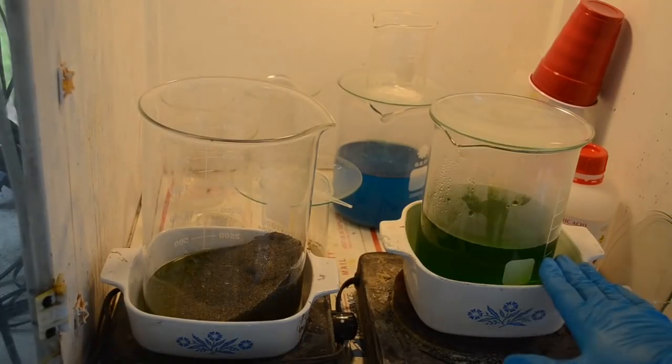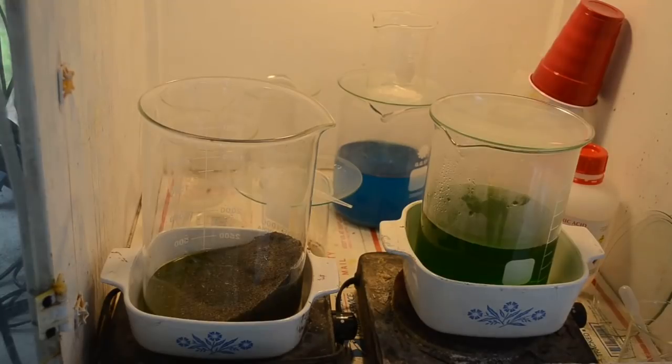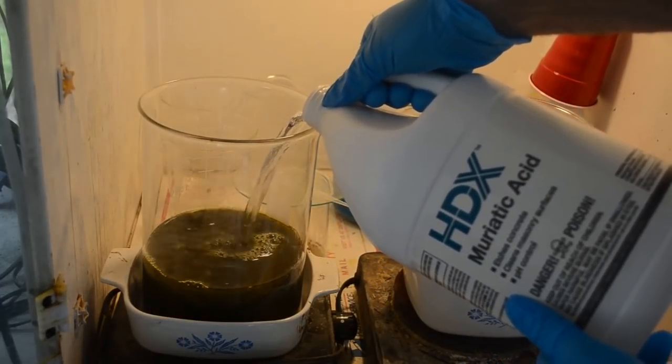Alrighty, so I got our liquid in here, but the first thing I'm going to do before I try to drop the gold out of this and fill the fume hood up with nasty sulfur dioxide gas is I'm going to get this second extraction started on this stuff over here. Oh, some more muriatic acid.